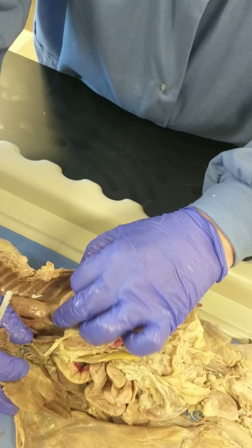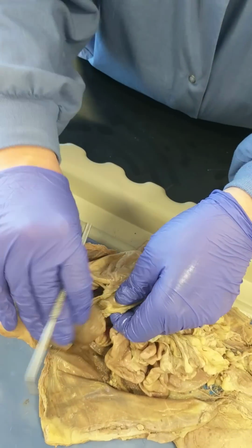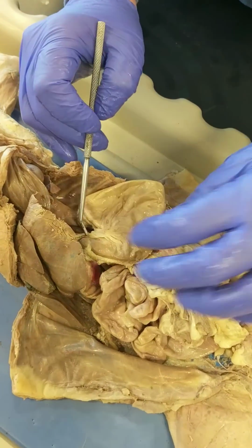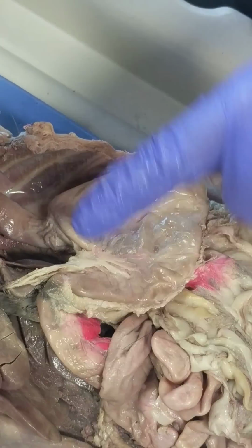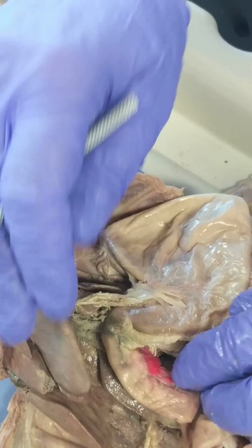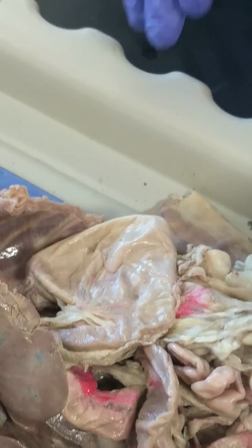So the esophagus, move the liver over. The esophagus comes down into the stomach. This whole thing is the stomach. And where the stomach narrows is called the pylorus. And between the pylorus region of the stomach and the beginning of the small intestine, there's a valve. And that's called the pyloric valve or pyloric sphincter, either one. And so material is squirted periodically into the small intestine.